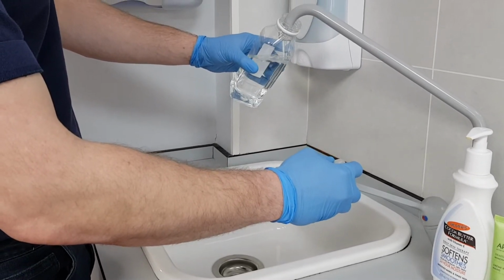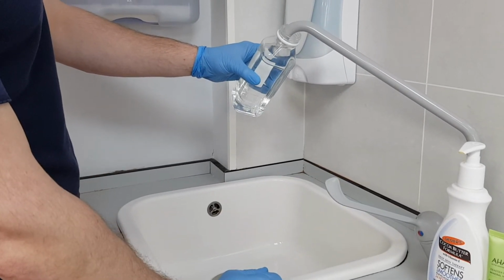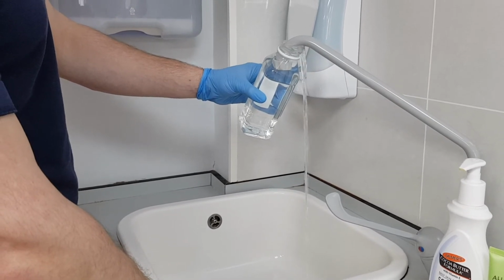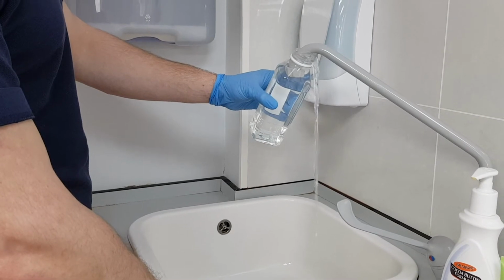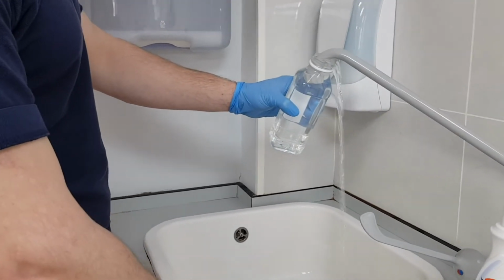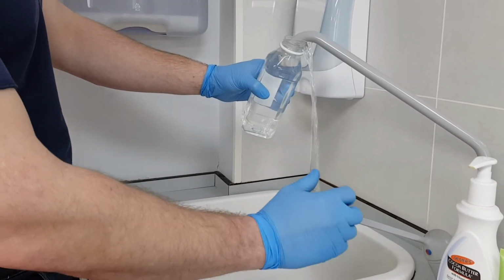It is important to remember that chlorine dioxide is a gas and can easily be lost from water samples through agitation. So don't sample from outlets that spray the water into your container. Take the sample with minimal agitation. We recommend that you should fill your sample container until the tap end is submerged and then continue to overflow the container for several volumes. This can minimise the loss of gas caused by splashing.